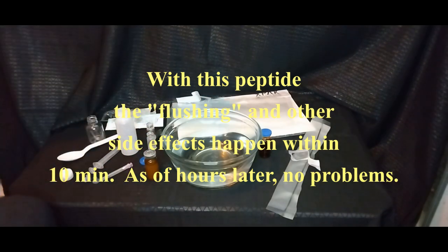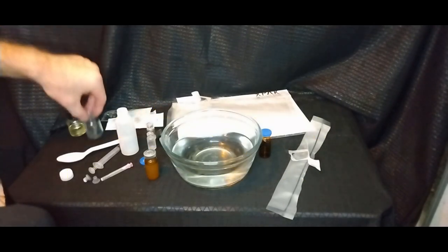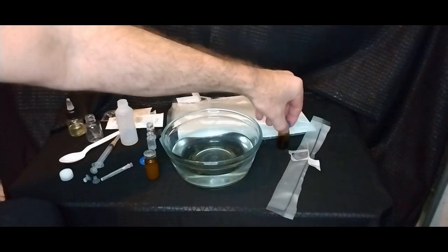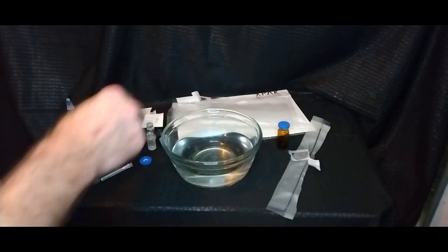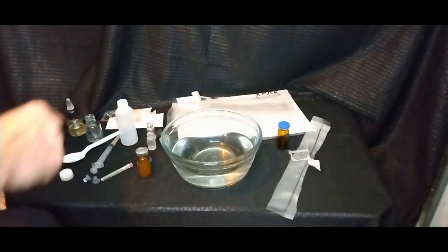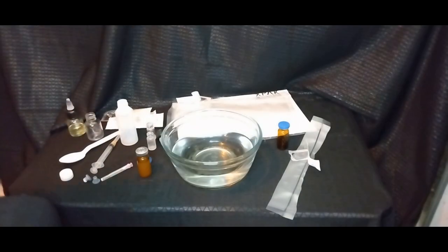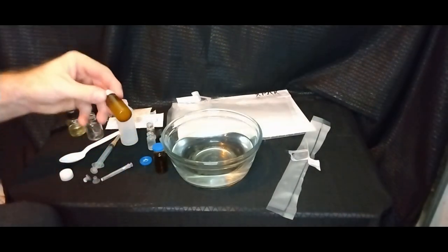Now, when these ship out, see we've got half of the oil left, generally I would have had twice the volume of solvent in there, and that's what you get with the kit. Still got a bottle here that's sealed, and it's enough to do 20 milliliters in these vials, or if you want to stretch a little bit, or you got stuff that's easy to work with, but generally you'll do about 20 milliliters. So, yeah, no facial flush, no issues, no anything. So, yep, we're good. That's in solution. That's good.